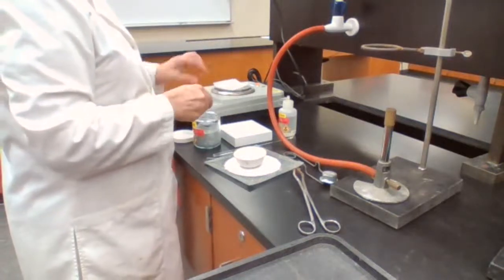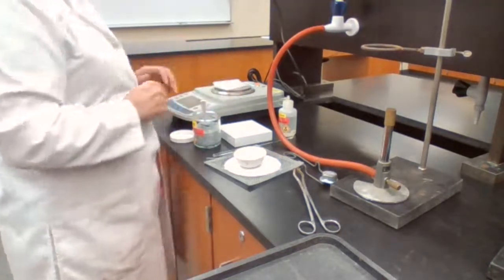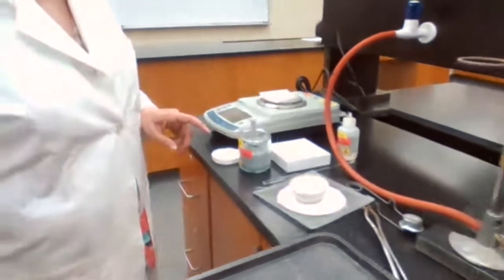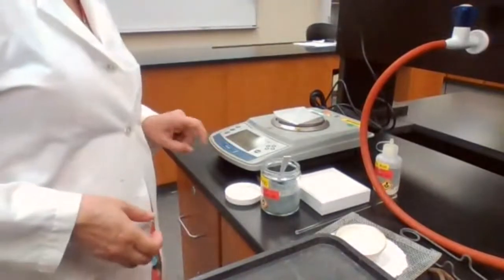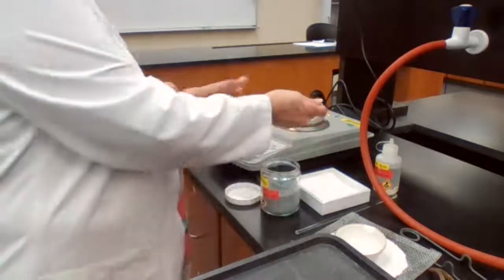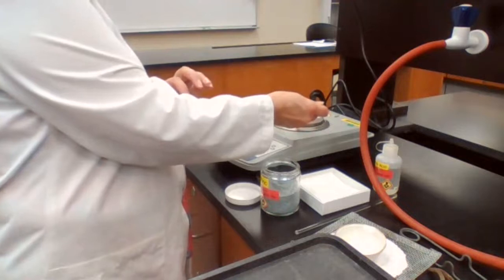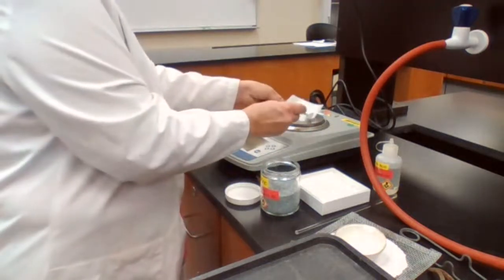We have a chemical that you want to measure the mass. So I place the weigh paper, just explaining to you one more time how we did that for experiment 1. Weigh paper, press the tare button to get the mass of the weigh paper to 0. Then I can add the 0.5 grams. Too much.